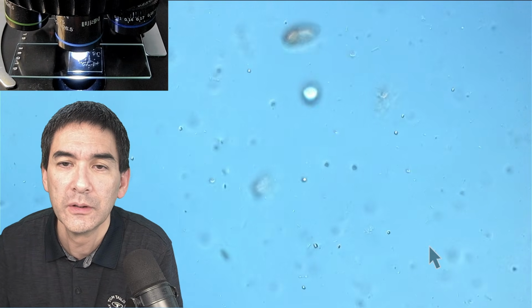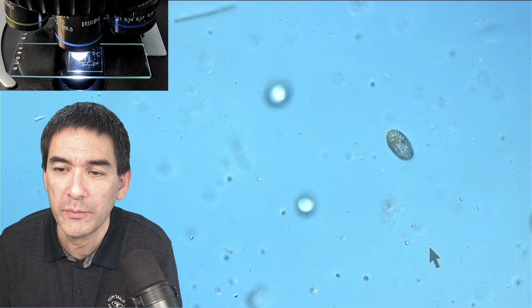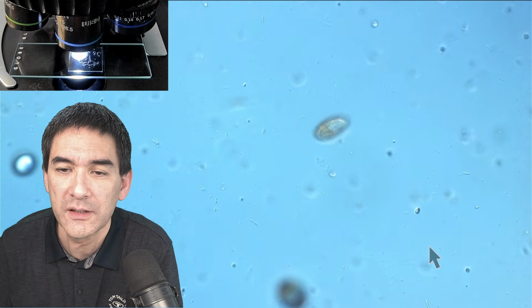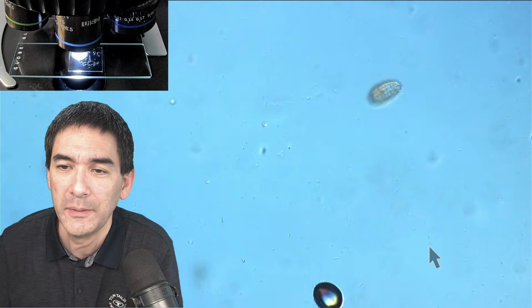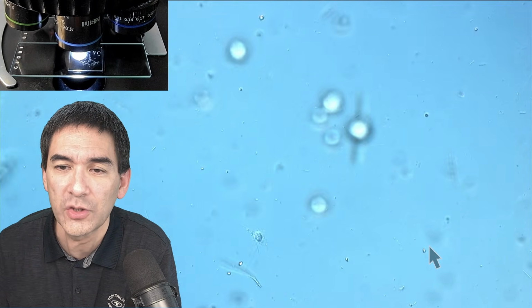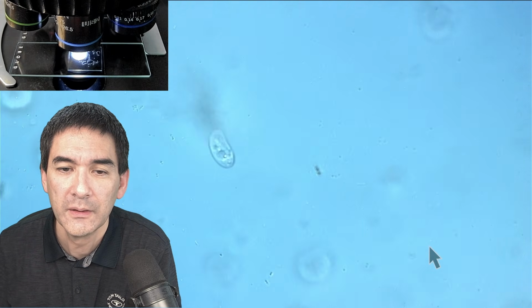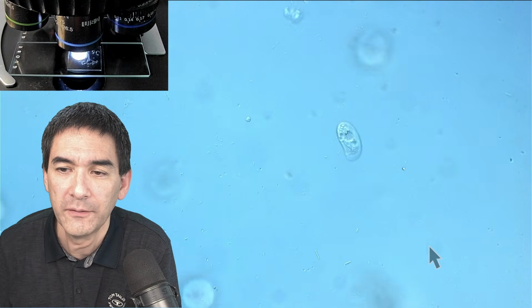which is good. And it shows that, as I mentioned before, the whole trial and error is really important. But I'm surprised that the overall number of cells is not quite high. So maybe I have missed the wheat grain a little bit. Because there are also not so many starch grains in here as well. Oh, there's something over here. What is this here? Here we go. Yeah, it's moving not quite as fast as before, but still fairly quickly.